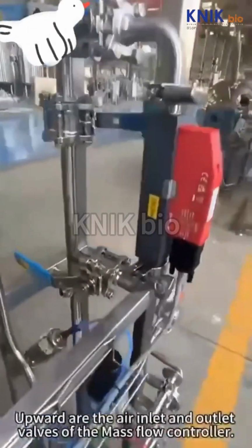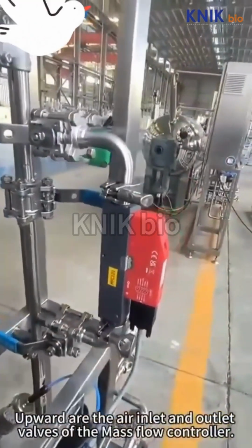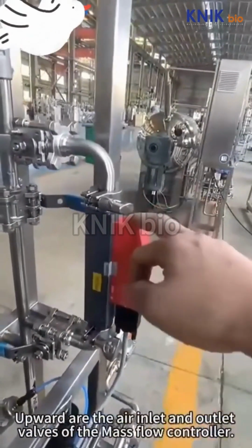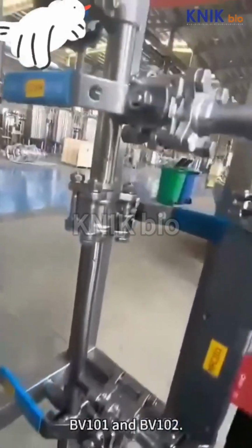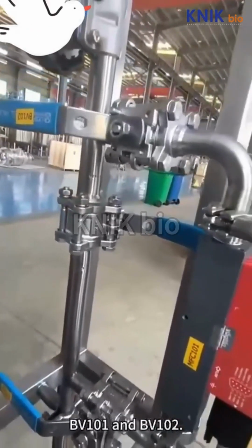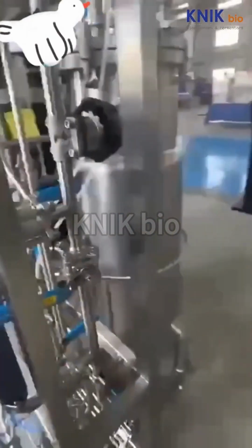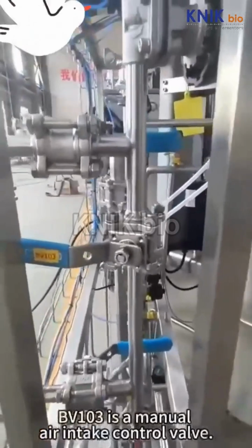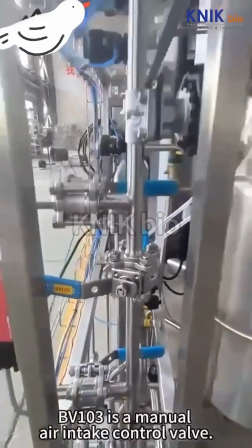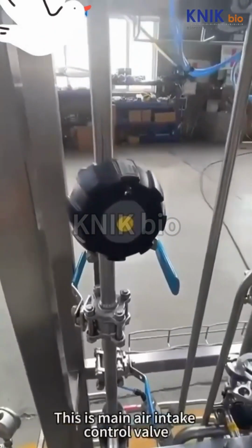Upward are the air inlet and outlet valves of the mass flow controller, BV101 and BV102. BV103 is a manual air intake control valve. This is the main air intake control valve.